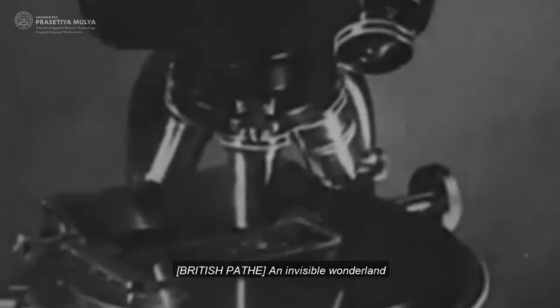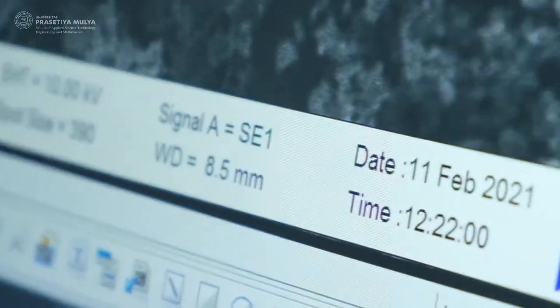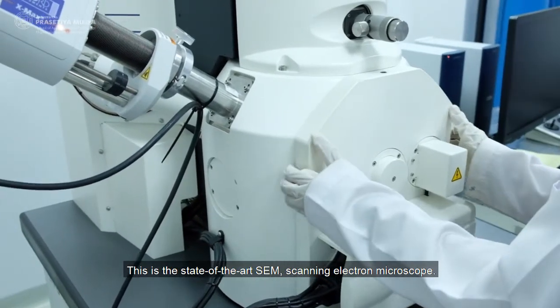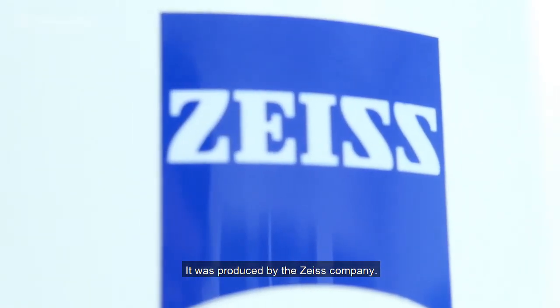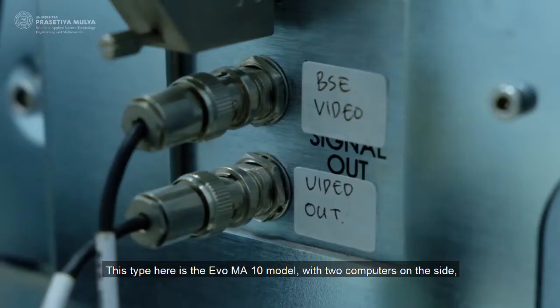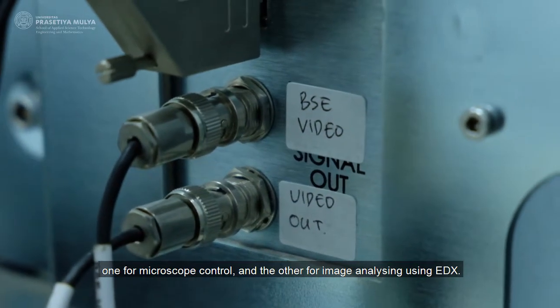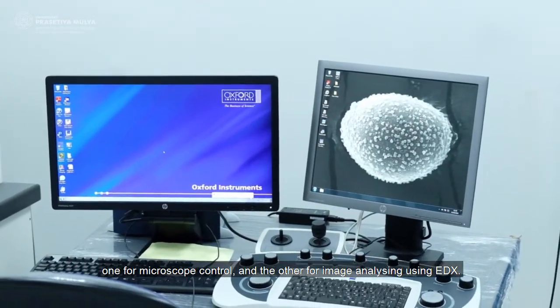An invisible wonderland is revealed and comes to life under the penetrating eye of the microscope. This is the state-of-the-art SEM, Scanning Electron Microscope. It was produced by the Zeiss company. This type here is the EVO MA10 model, with two computers on the side, one for microscope control and the other for image analyzing using EDX.